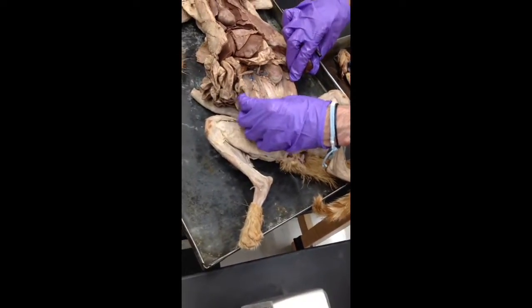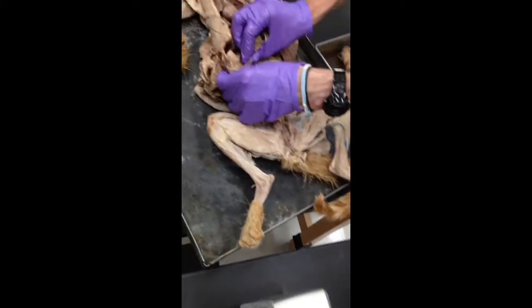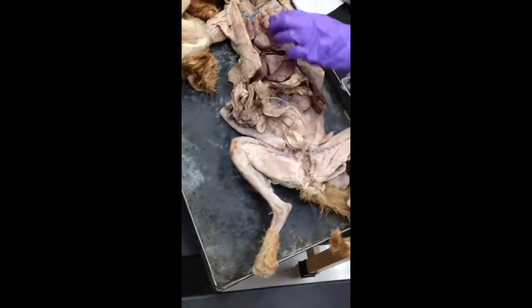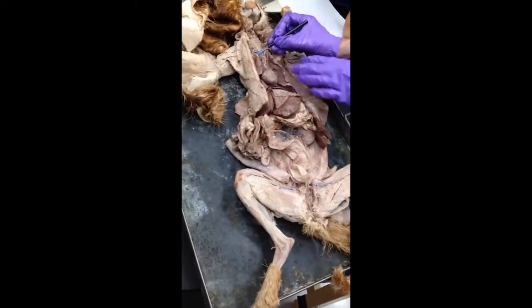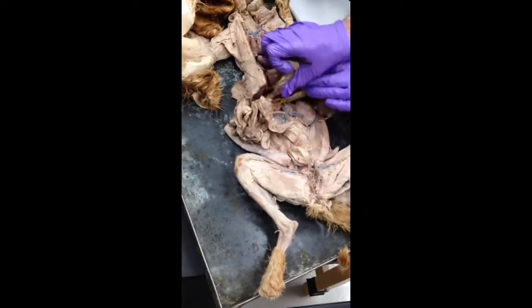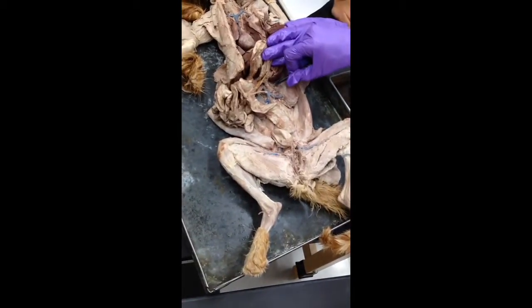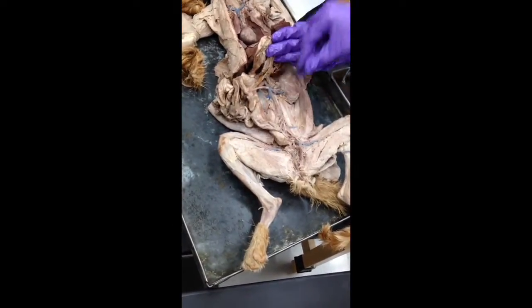That's the anterior. Oh, that's the posterior. What did you say was posterior up here? Like you said something like posterior and then something anterior. So this is the precava. The postcava is back here. So all the way back down here, this big vein is the postcava. And that's the precava.